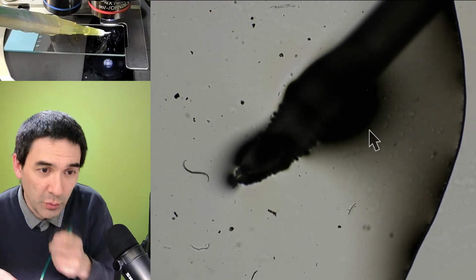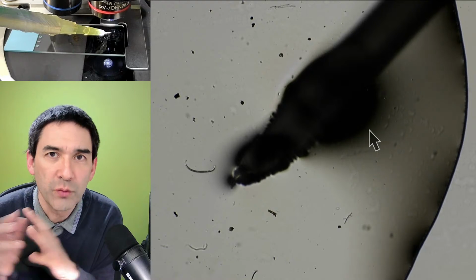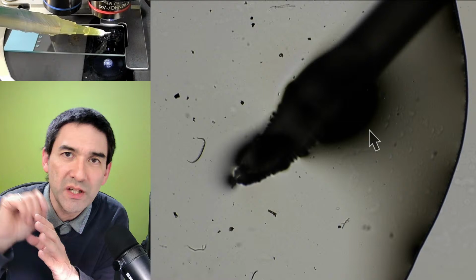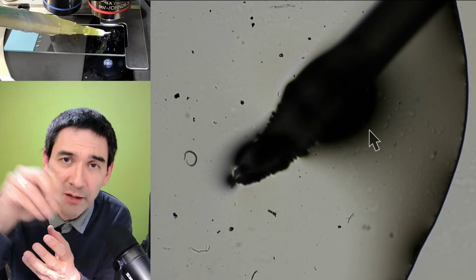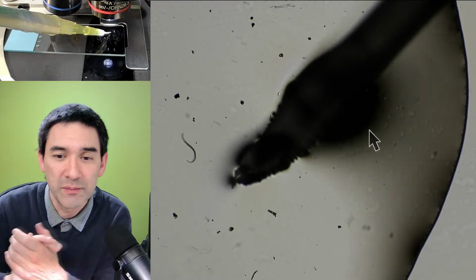Now, why would you want to do that? Actually, why would you want to transfer it? I usually transfer organisms this way because I want to remove all of the remaining particles that you see, just to get a nicer video. For example, when I made videos of tardigrades and so on, I tried to pick it out individually to get all of the particles removed, so that you only have the organism that I want to show.